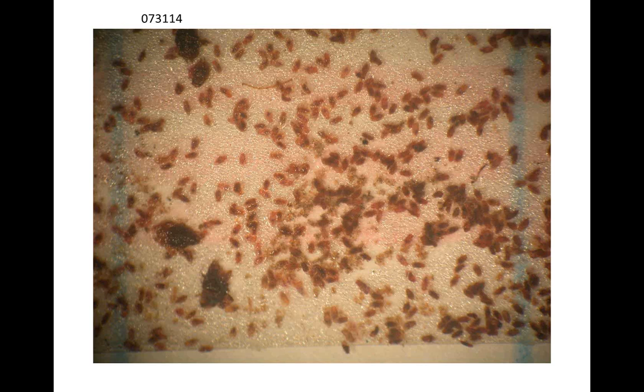It could be just slightly different ages, and some of them have started to develop that pink coloration, whatever it is. Others have not. Yeah, and I think it's real quick, everybody here. What John does is he uses his criterion. If it crawled on there, then that's what he counts, because the demarcation is that once they settle down and start exuding the felt, they're not going to crawl on the tape. Yeah.